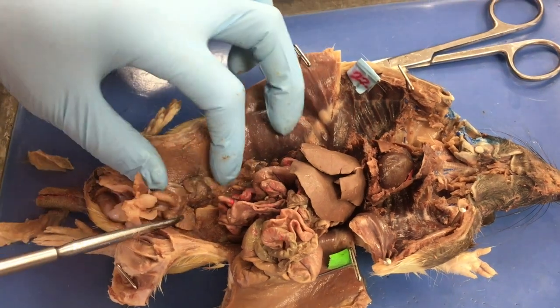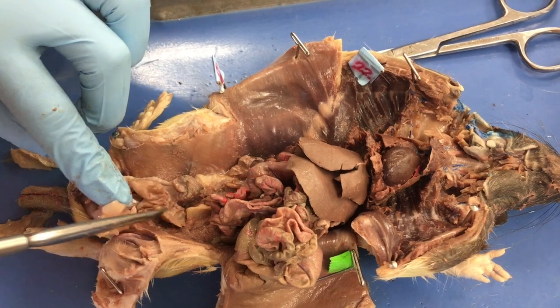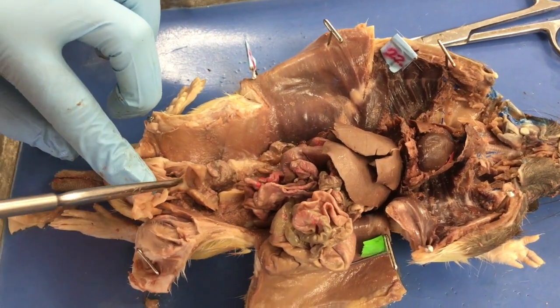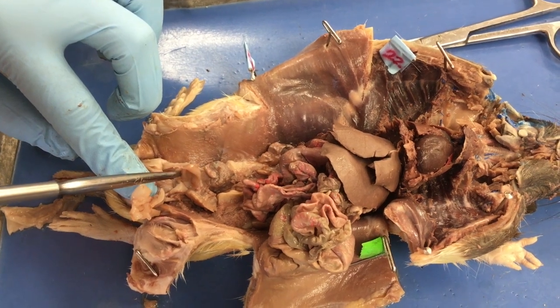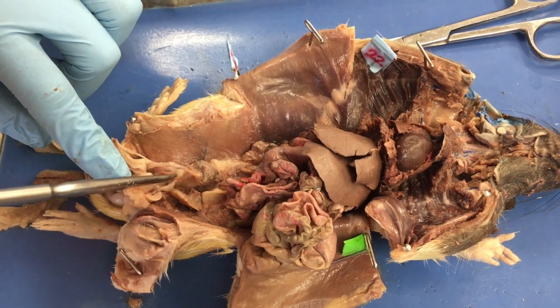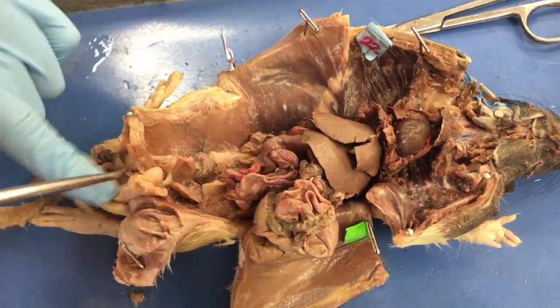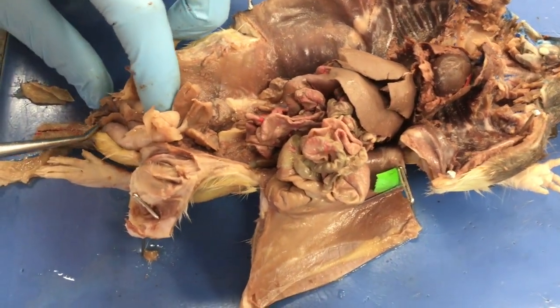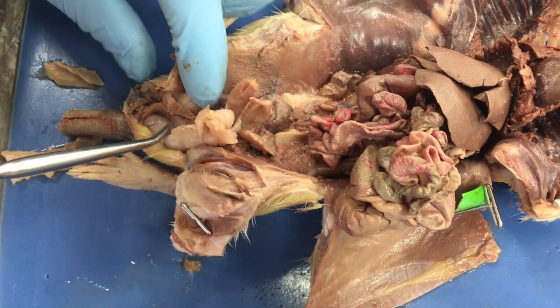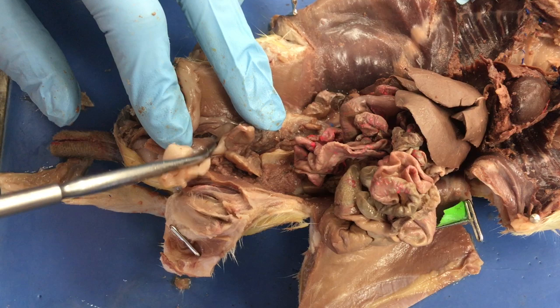These two ram's horns. They look like ram's horns to me. There's one, there's the other. That's the seminal vesicle. And then you have this bladder here. Surrounding the bladder, you have the prostate gland. So there's one part of it, there's the other part of it. This guy lost his penis in the dissection, so I just removed it out of there. And then when we come down here to the bottom, we have the testes, and then we have the epididymis. So testes and epididymis, seminal vesicles, bladder, prostate gland.